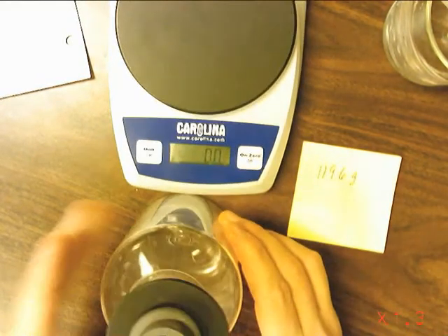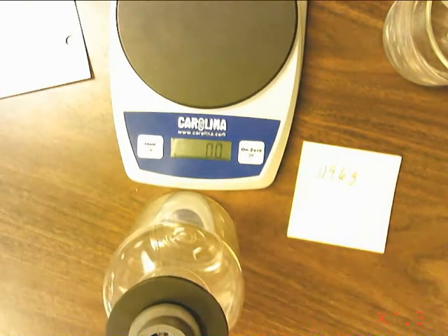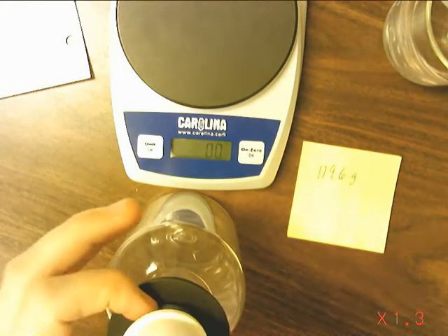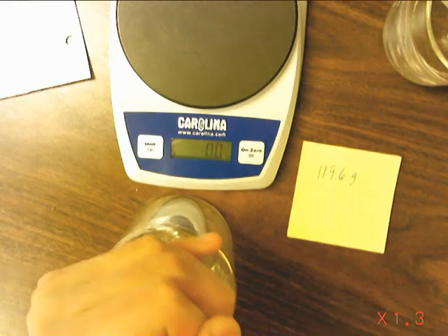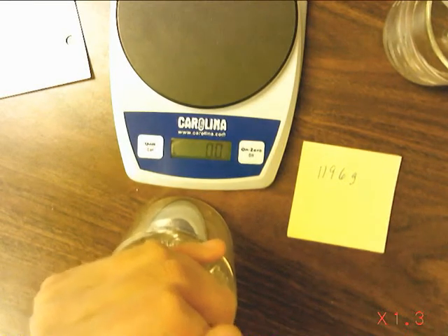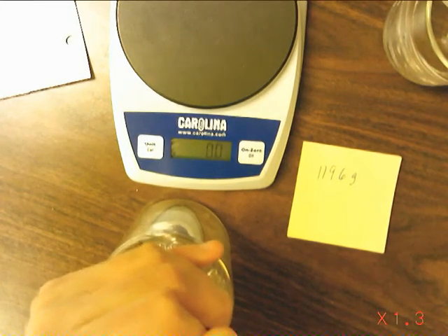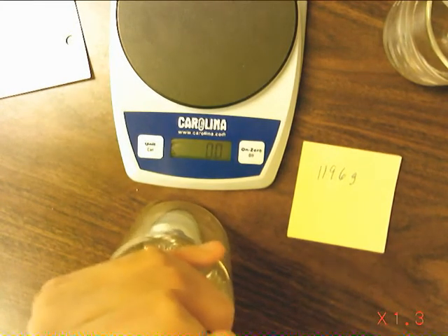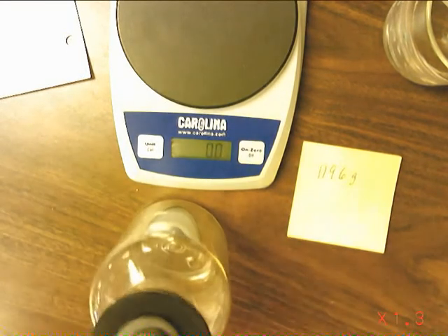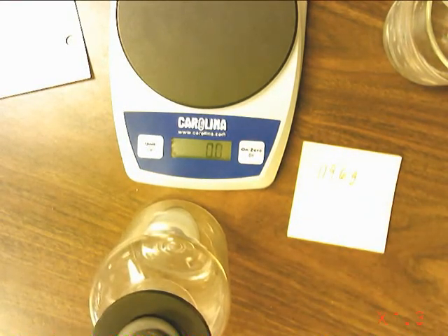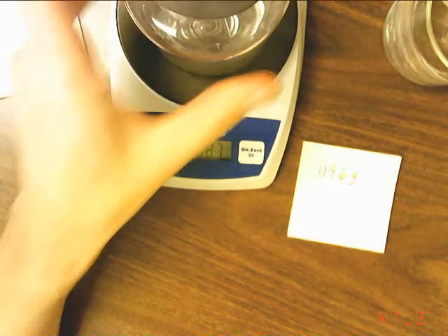The next step is the hard part. I'm going to stand up for this. You now pump out all the air. Place it back on the balance.